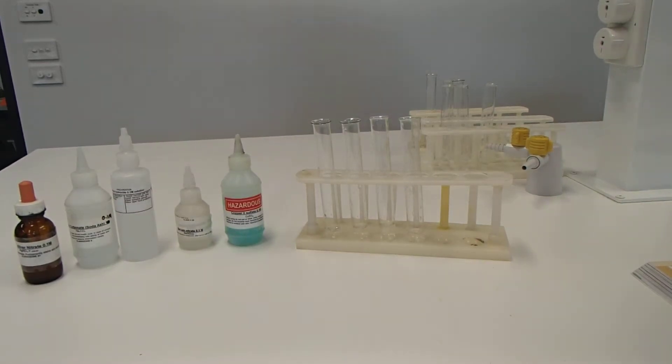Hi guys, Mr. Kerr here again in the Mount Aaron Science Labs, back to do another prac for remote learning.